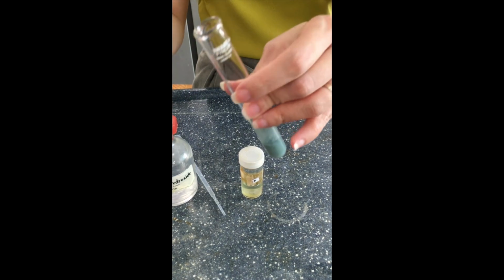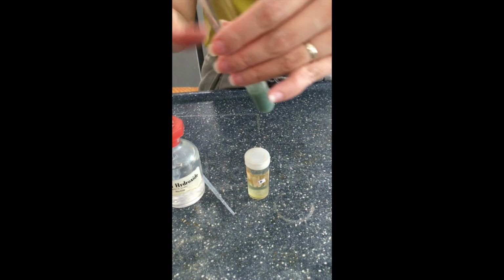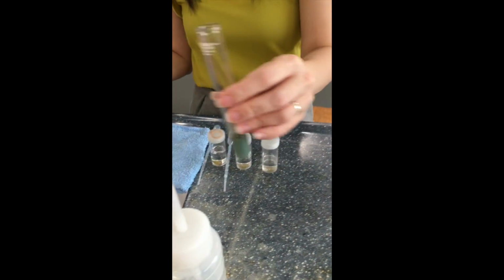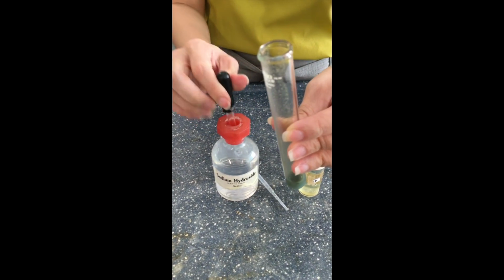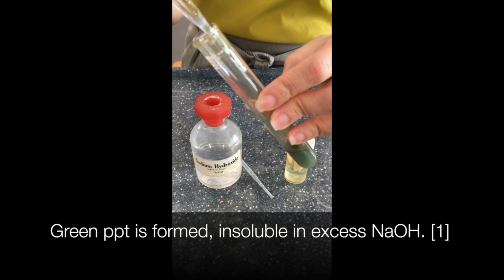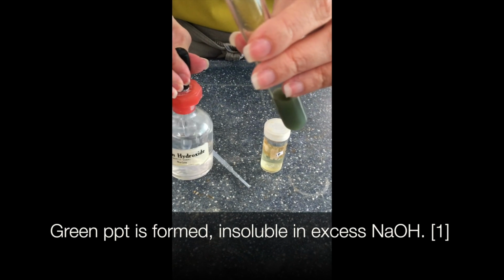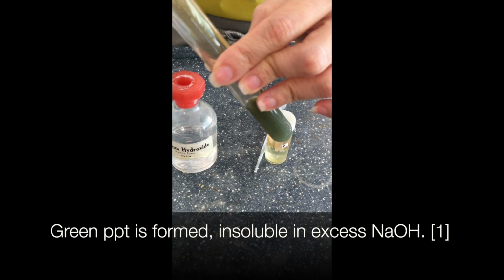So because they say until no further change, which means we want to add in excess, what we would do is pour out some of this PPT so that it's much easier to see if it's soluble or insoluble. And then we'll add sodium hydroxide in excess, which means we add till about 1/3 or half a test tube. And if you look at the chart, it says that green PPT is insoluble in excess sodium hydroxide. So that's what we expect to see.